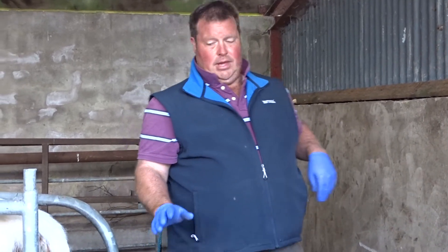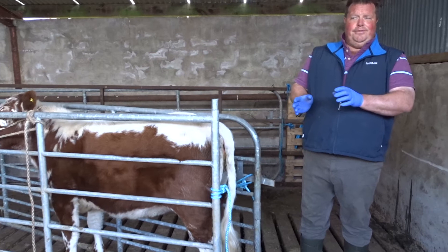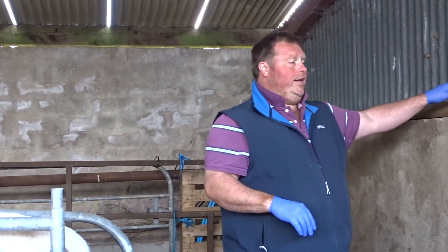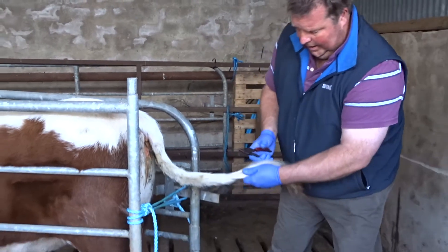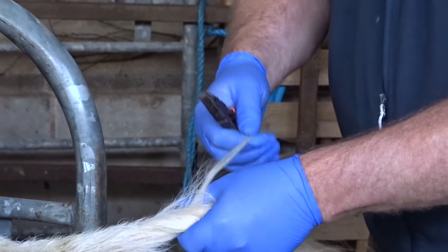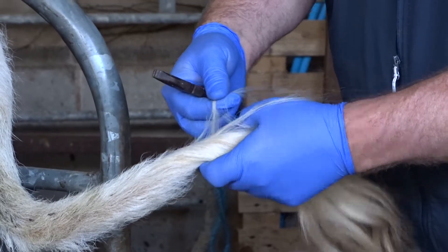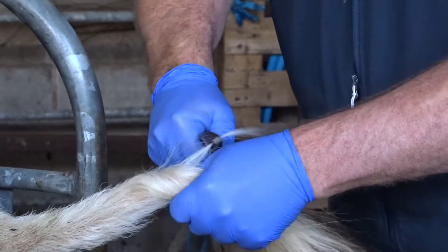Now this is an eight month old heifer — relatively easy to pull out. I find younger calves are a wee bit harder to pull out. You might like to use a tool, especially if you have a little bit of arthritis in your fingers. A simple pair of pliers should do adequately. Basically again, pick the right amount of hair — not too many, not too little — grab it like so and pull.